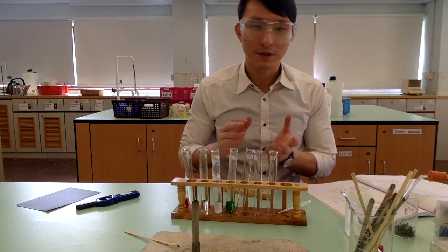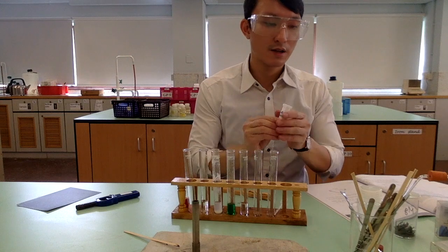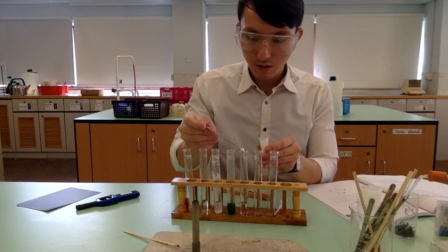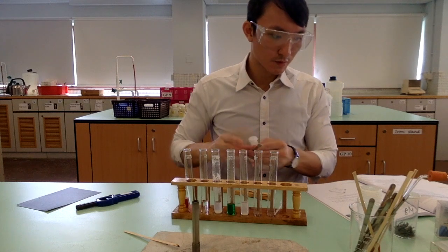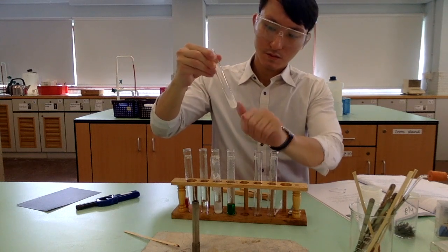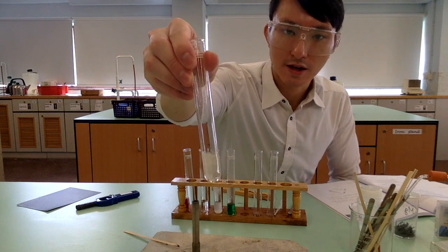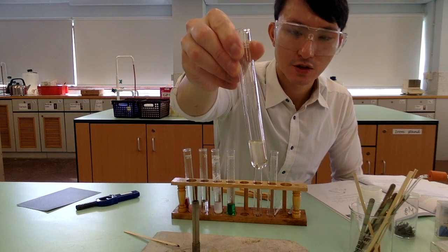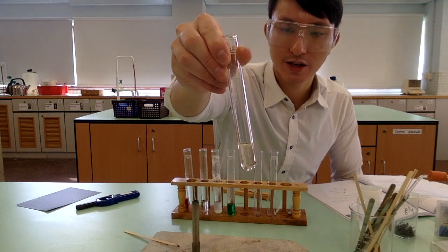Now, we will do something very similar, but this time with calcium hydroxide. Again, 1/4 of a spatula measure. As you can see here, the solution has turned colorless upon adding the solid. So you see the white solid has dissolved. So there is a reaction between calcium hydroxide and hydrochloric acid. We don't even have to heat it. So the reaction can take place without heating.